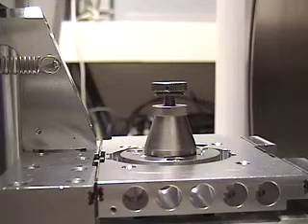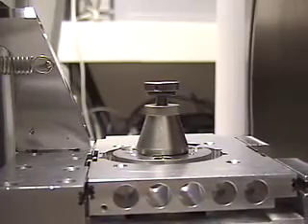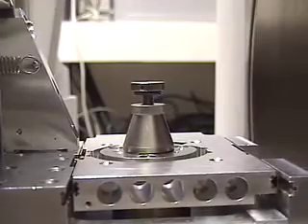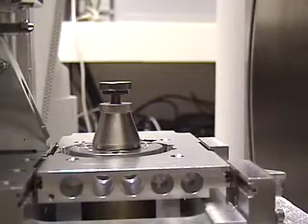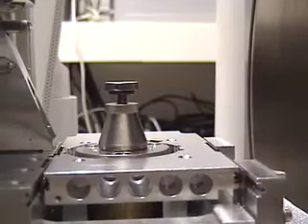The stage does a small rotation and then starts to move simultaneously in X and Y. Let's watch it rotate and then move quickly back to the stage centre position.